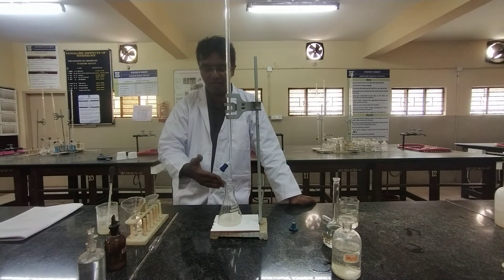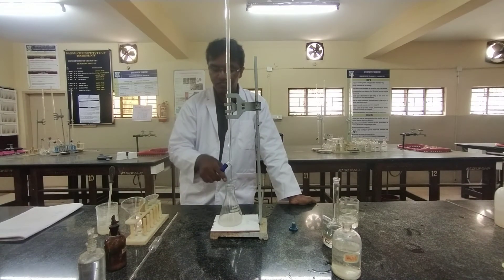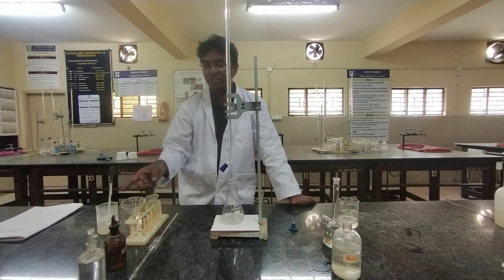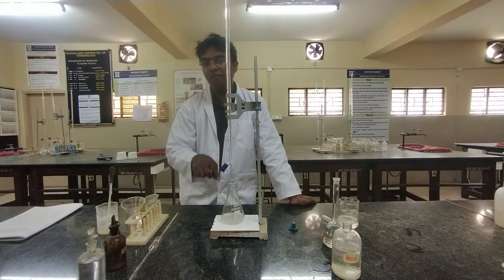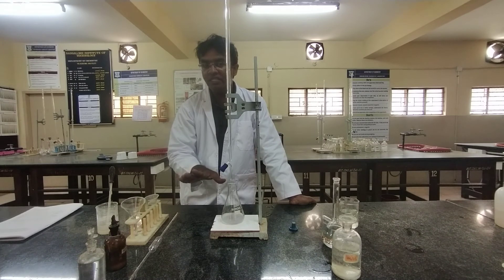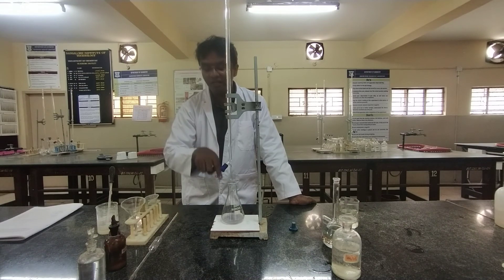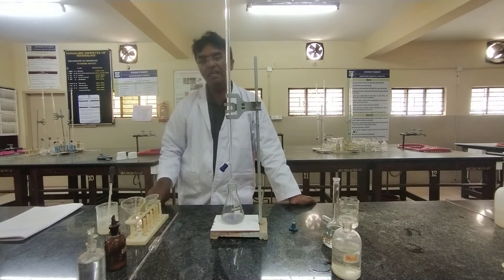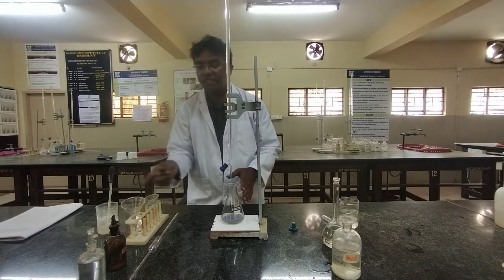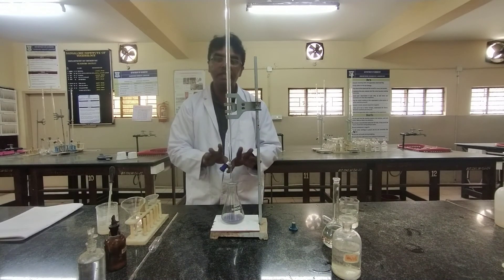The reason is: in the beginning there is a higher concentration of iodine, and under high iodine concentration starch forms a stable complex, so the blue color will not disappear even when the end point is reached. That is why we add starch near the end point where iodine concentration is lower. Under lower iodine concentration, starch forms an unstable complex, so once the end point is reached the blue color disappears — its disappearance is the end point.